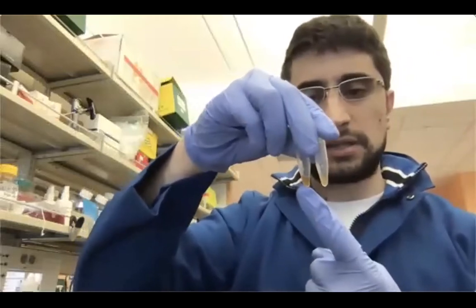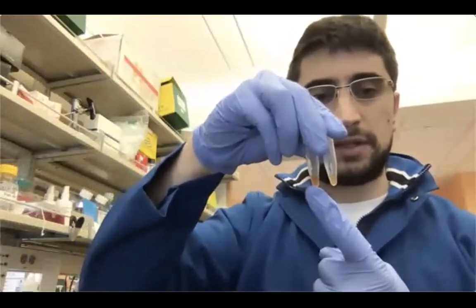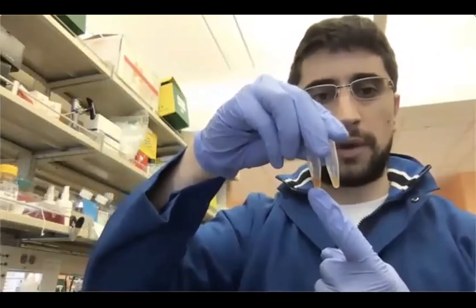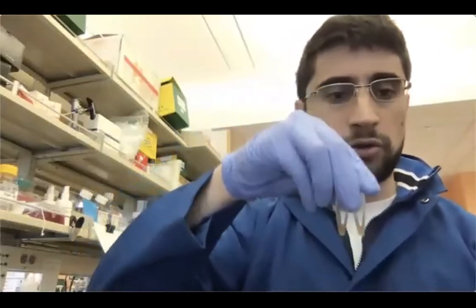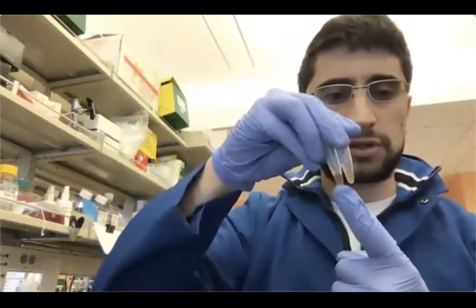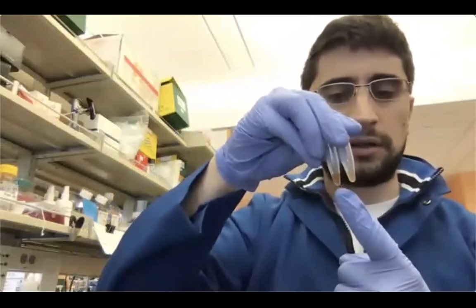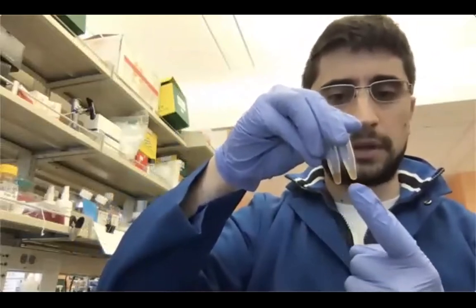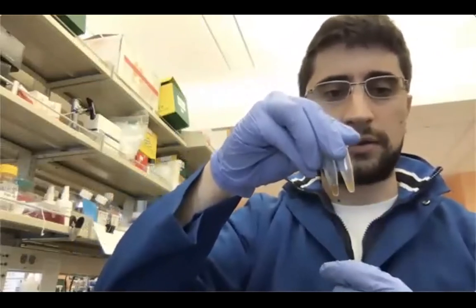And in this case, we have 90 plus 50, which is about 140 microliters of mixed DNA library and AMPure beads. You also notice a color difference, okay? So sample number 2, of course, the more the beads, the darker the color. And sample A or sample 1 is lighter, okay?